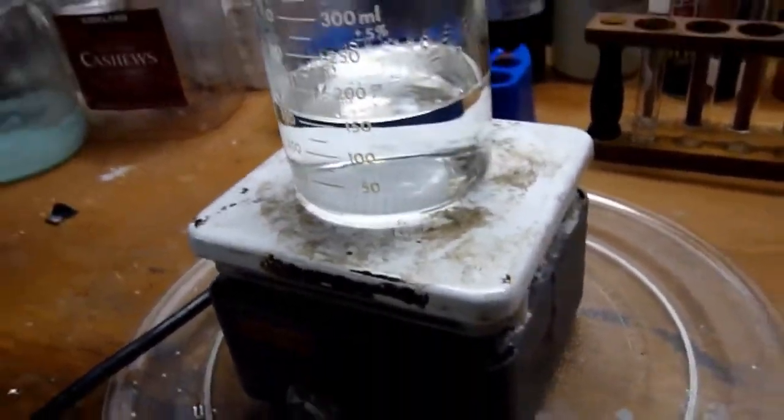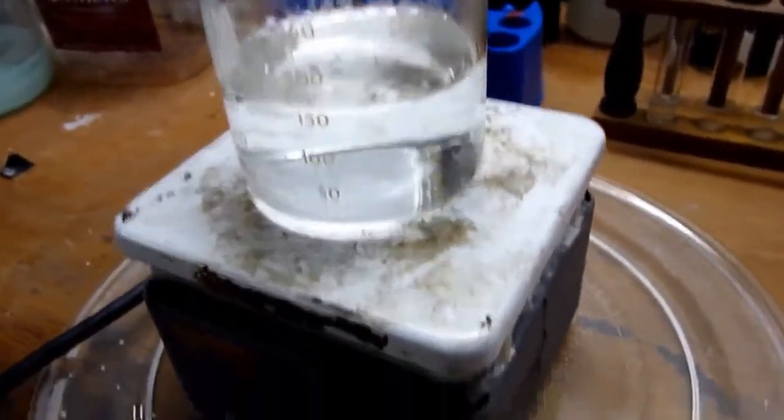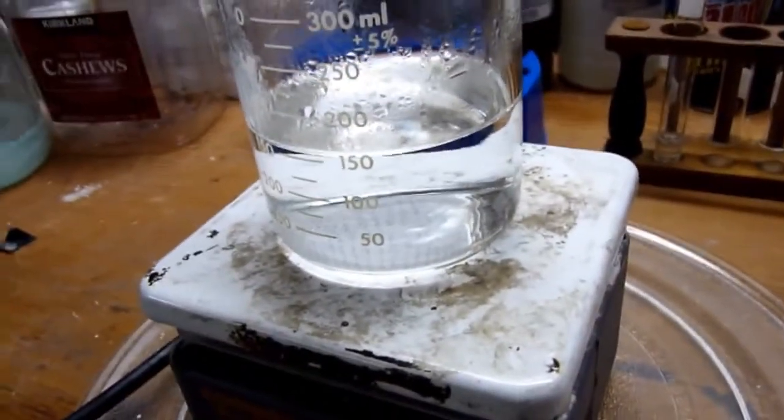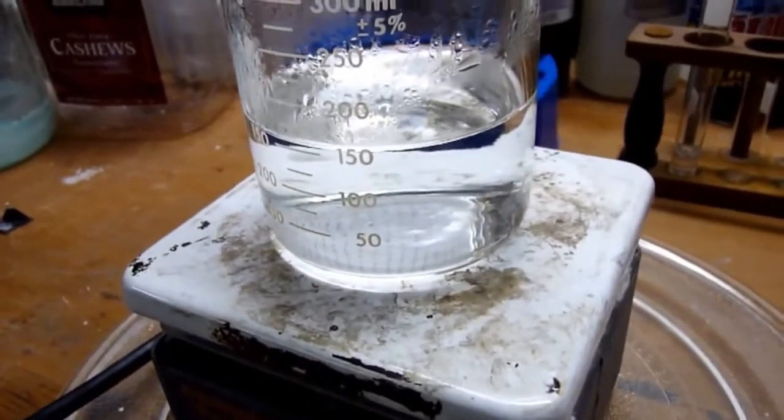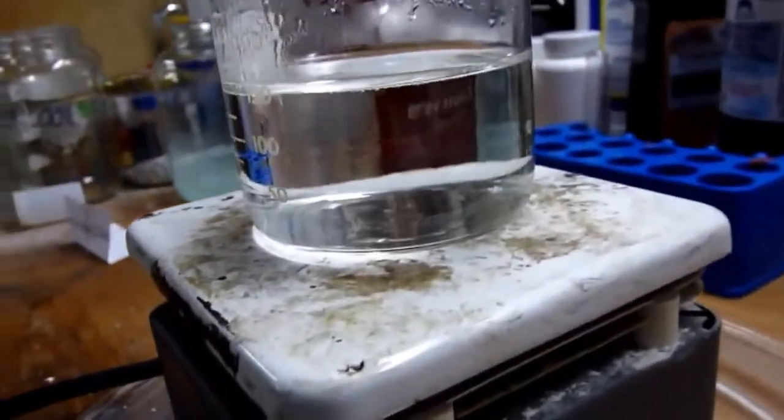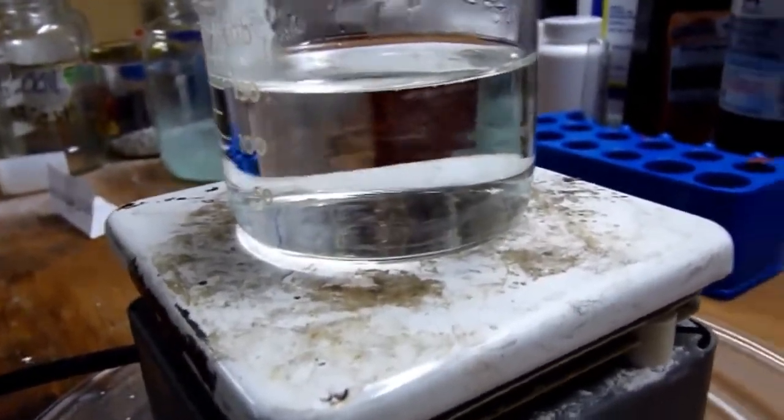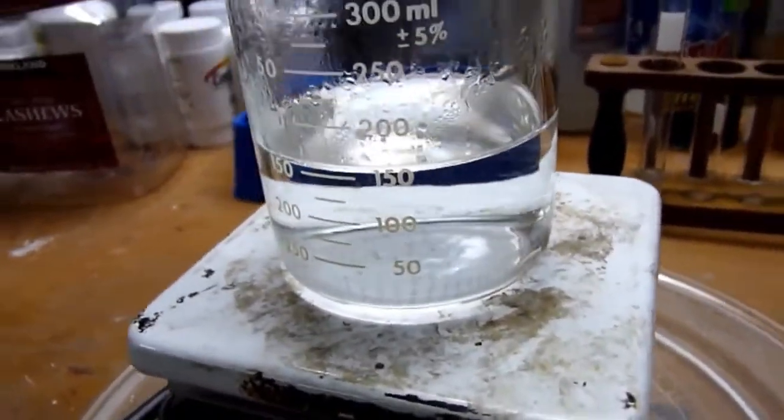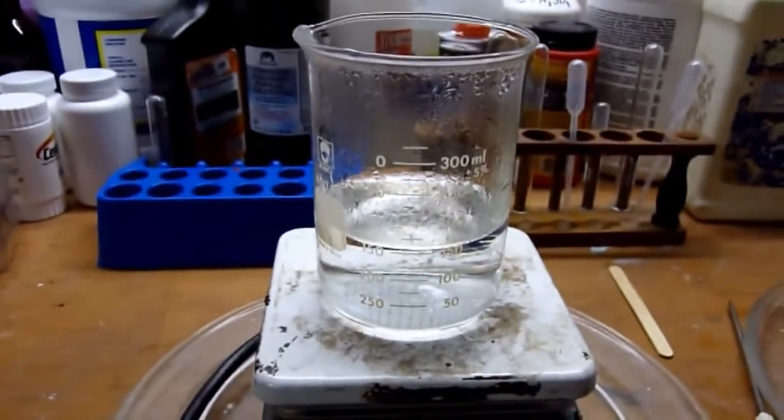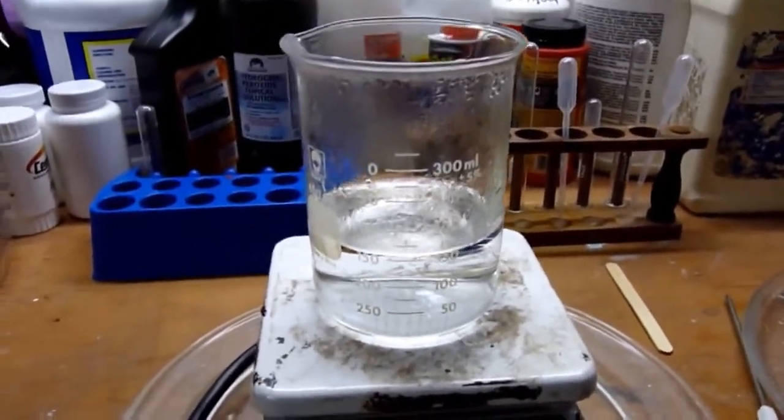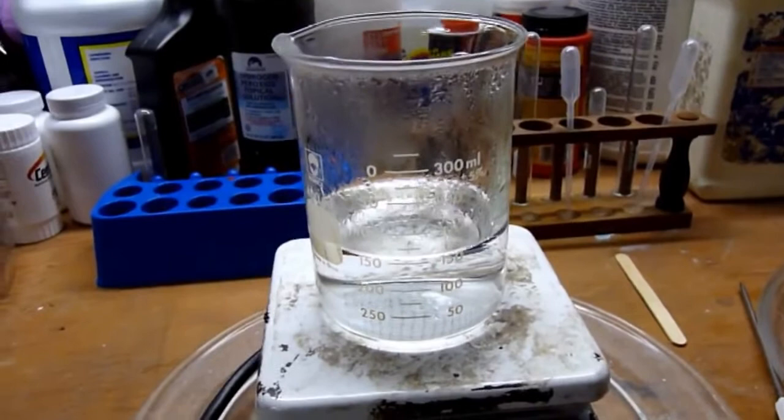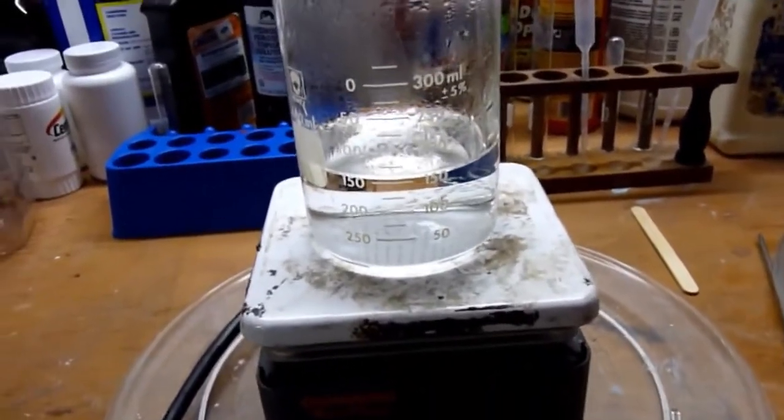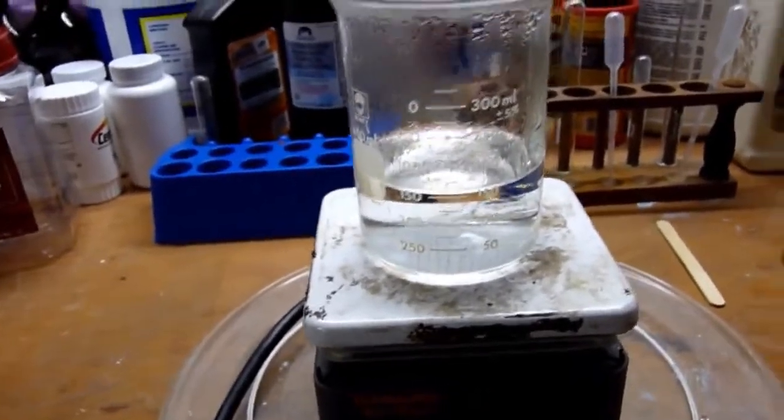Furthermore, you don't know if this was because the beaker is so clean, it could actually be over the boiling point right now as a superheated liquid. And the introduction of some small nucleation point could cause it to spontaneously boil. I don't think that should happen because there are already bubbles in this which would probably cause that. But I wouldn't do it just in case. I know Mythbusters did something about this before with a cup of water in the microwave and then when they stuck a spoon in it, it all instantly boiled and threw hot water everywhere.